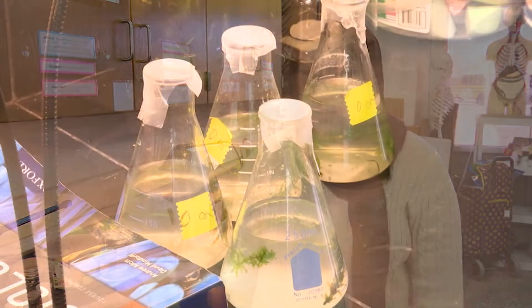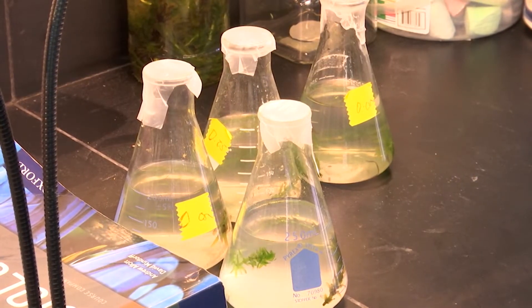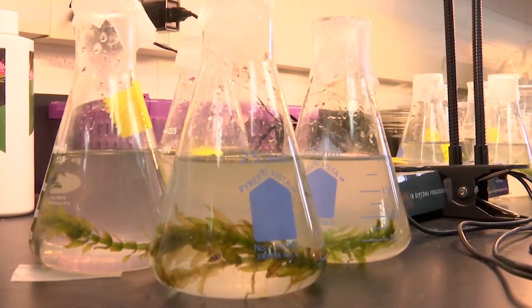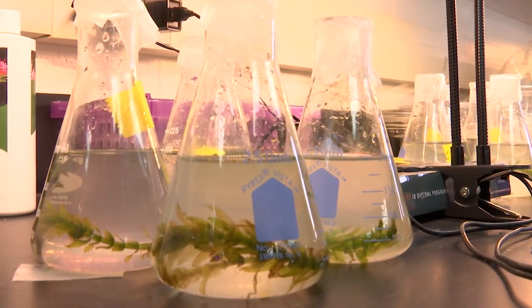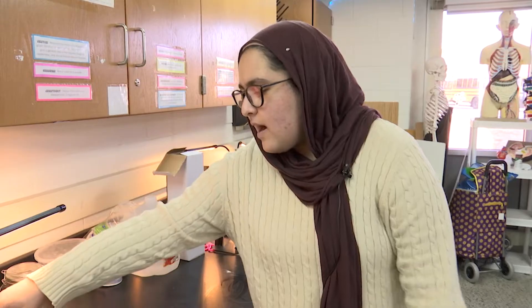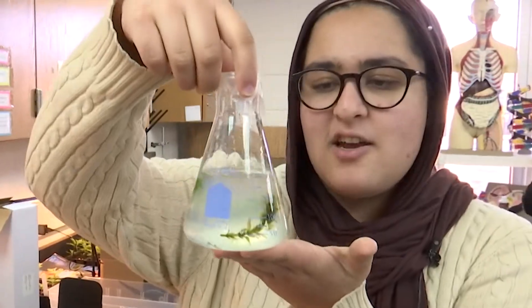I decided to study the effect of sunscreen on photosynthesis rates of Elodea. When people go into the ocean or bodies of water, sunscreen comes off their body and it affects the life of the plants and animals in the ocean, so I decided to replicate that in this little flask here.